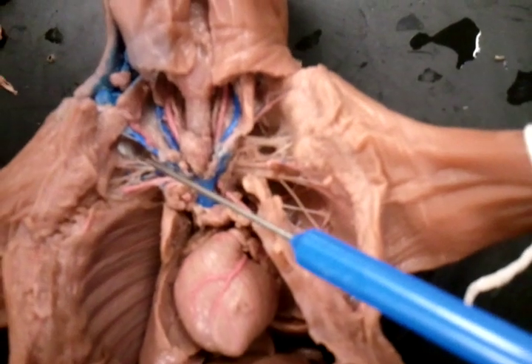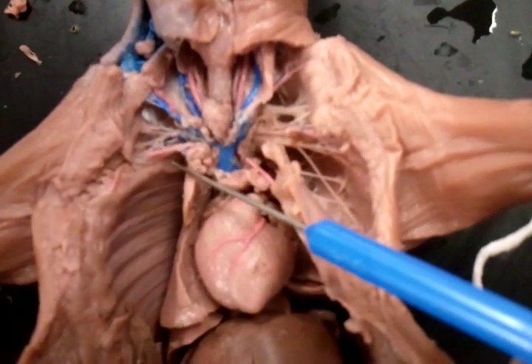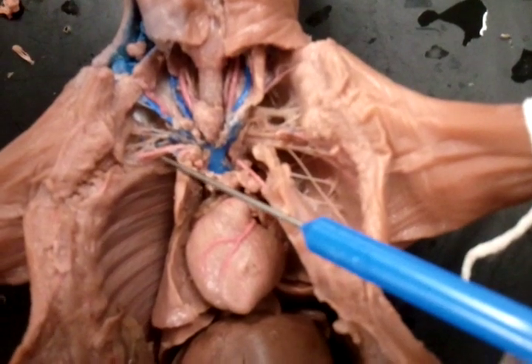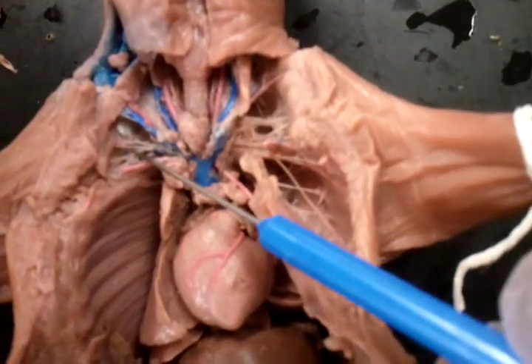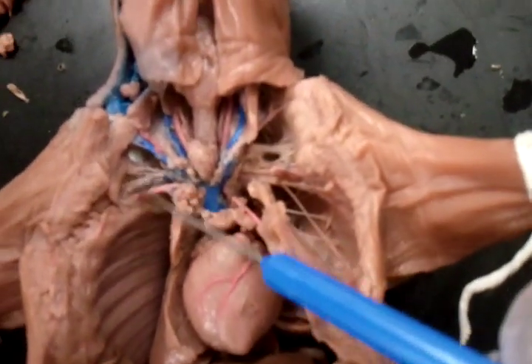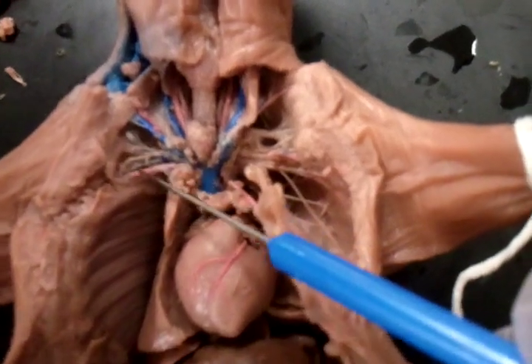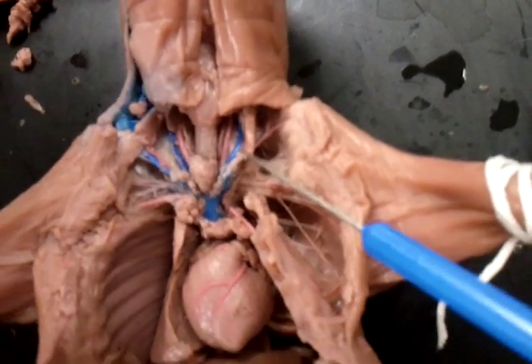Is it artery? Subclavian vein and artery — so which one is the vein? It must be like somewhere over here. Which one is the artery? Well, veins are always blue, so it should be somewhere here.